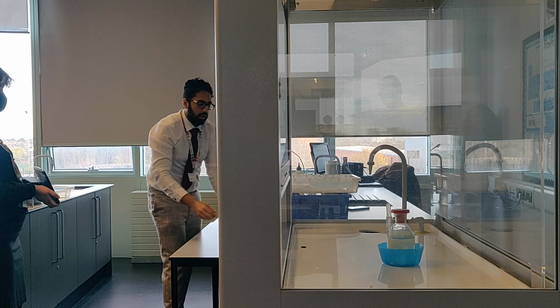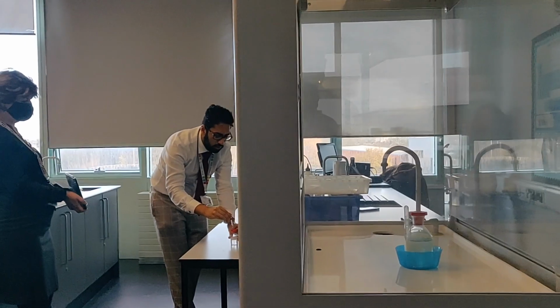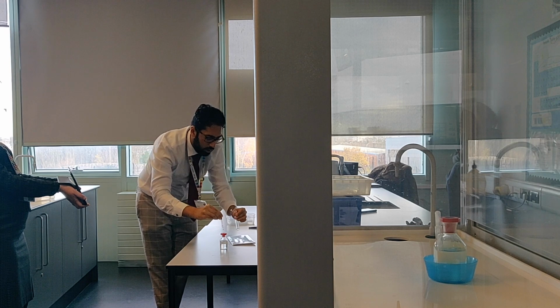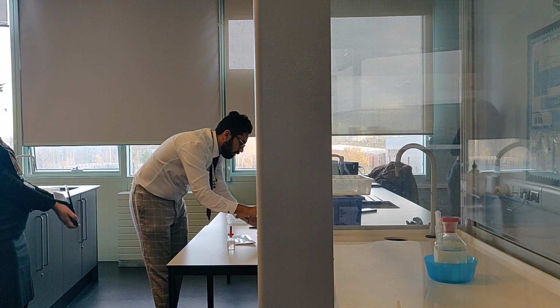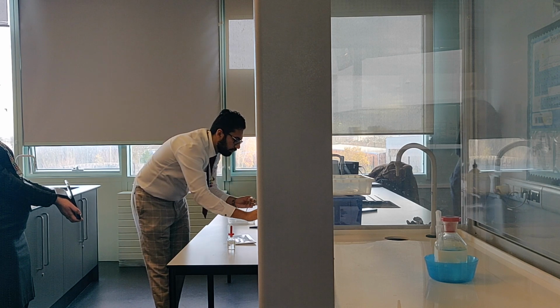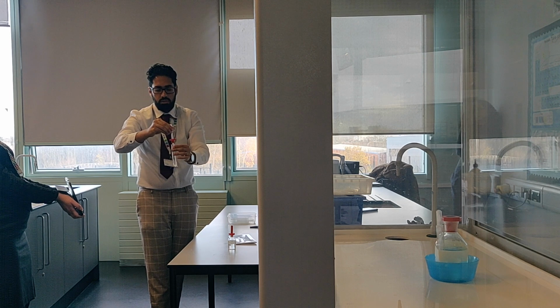And we're going to repeat the same thing with iodide. So first with dilute ammonia and then concentrated. I think you know what's going to happen anyway, but let me show you. 3, 4, 5, 6, 7, 8, 9, 10. Okay. 1, 2, 3, 4, 5. Silver nitrate, you know it's going to go yellow.